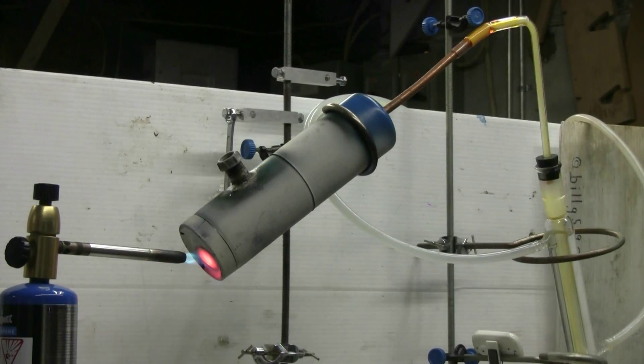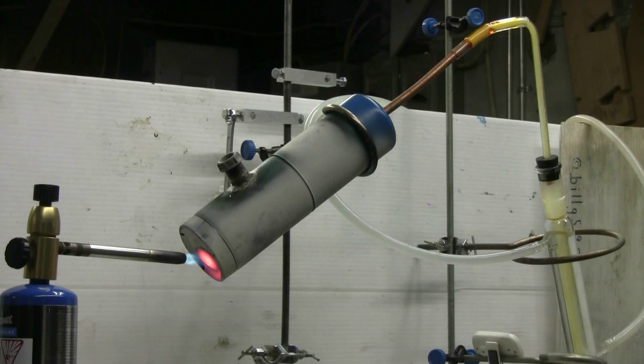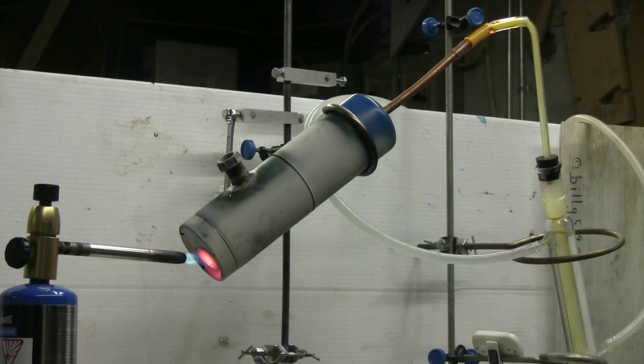It does take quite a bit of heat for quite a long time to drive this reaction forwards. I had to heat my reaction vessel all over and then heat the bottom red hot in order to get a good flow of benzene to the condenser.